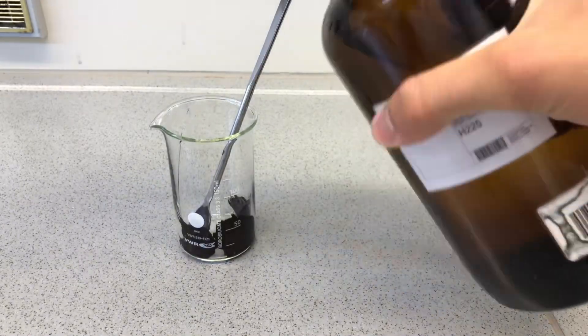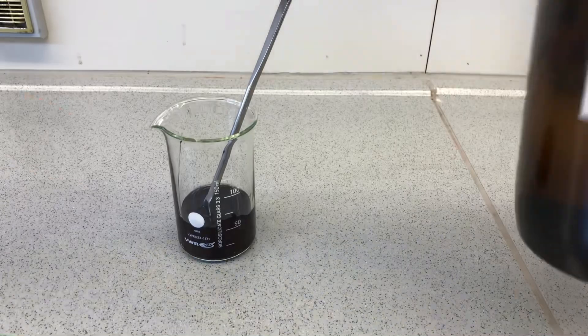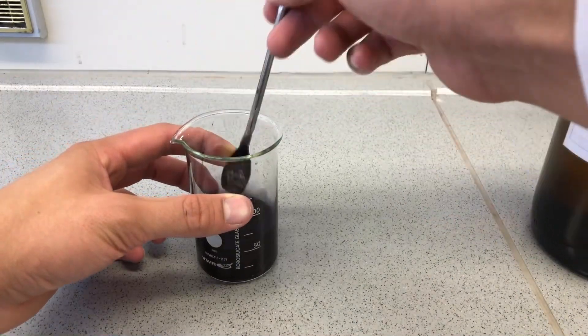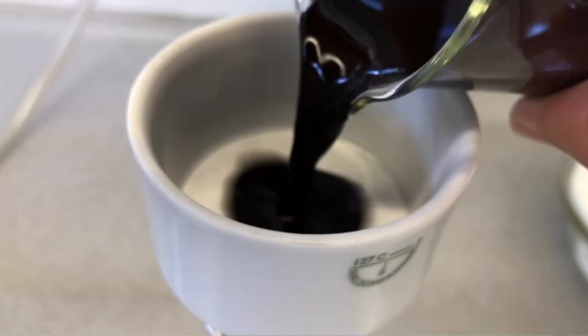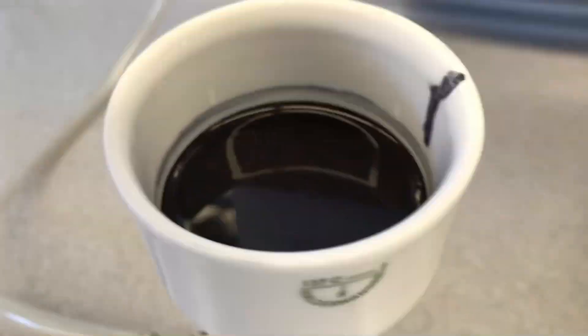The product contained some sort of brown contaminants. I added it to a beaker, followed by more ethanol. It was stirred, allowed to stand for 10 minutes, and then the second vacuum filtration was performed.